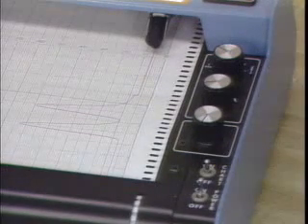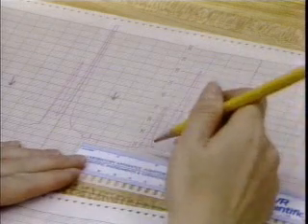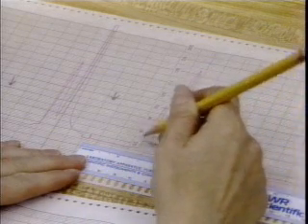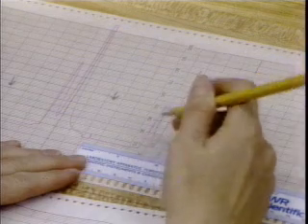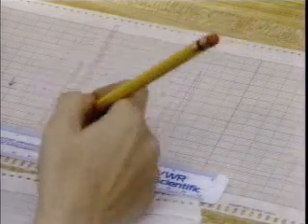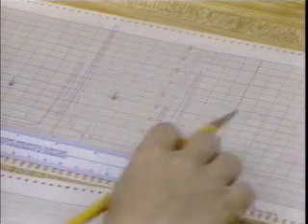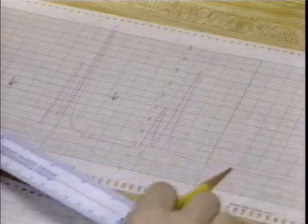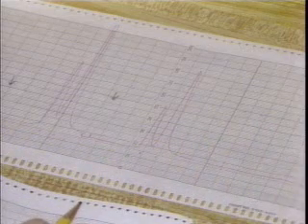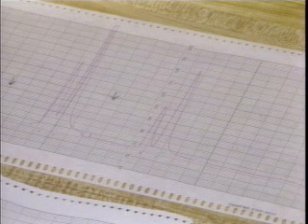The retention times of each of the components can be measured and compared with the retention times of pure samples of the components. Since the chart paper is moving at a fixed speed, the retention time, or time required for a component to come through the column, is proportional to the distance between the point marked on the paper at the time of the sample injection and the maximum of the peak for the component.